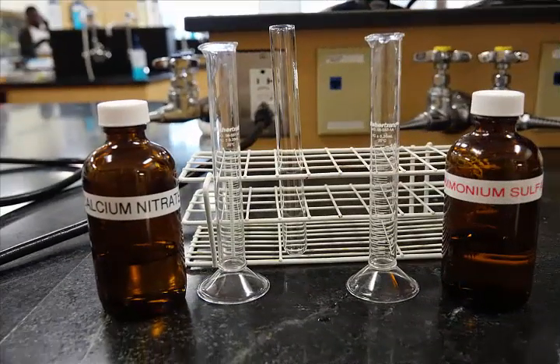In part C, you will need 1 molar solutions, which are standard concentration. You will do this by mixing equal amounts of 2 molar solutions. So this time you will need to measure your volumes more carefully rather than just adding 20 drops. The calcium ions will come from calcium nitrate, and the sulfate ions will come from ammonium sulfate. Again, record your observations. If nothing happens, check back every few minutes for about 10 total minutes.